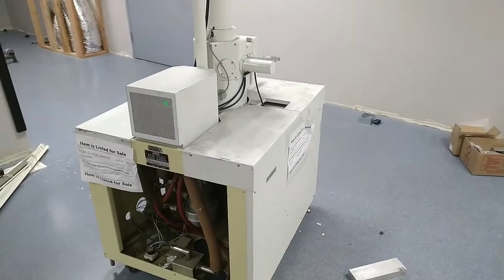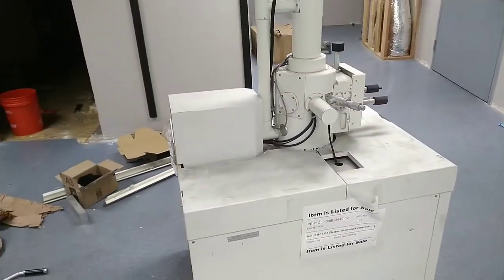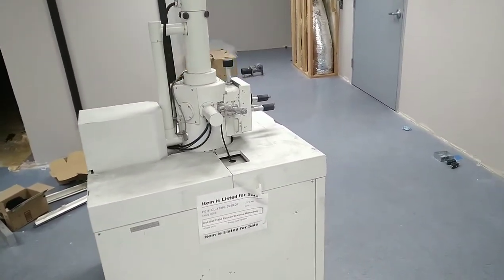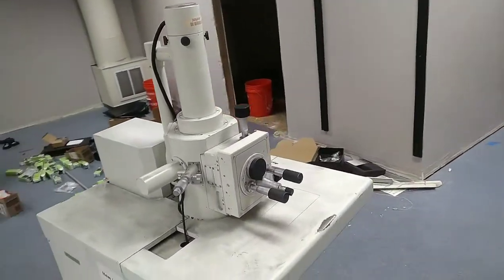The biggest issue with it is these machines are actually supposed to be in two parts — one is the microscope, and the other one is the actual monitor. So I will have to build the other half of this, but I think I've watched enough Applied Science videos that I can manage that.